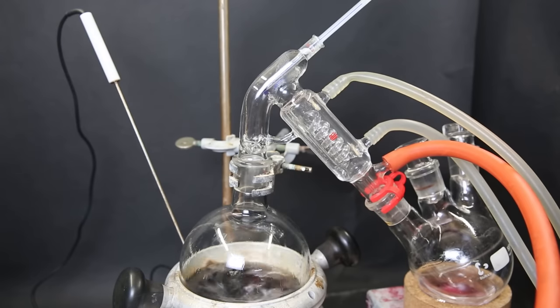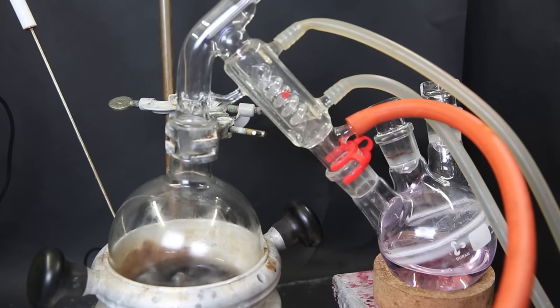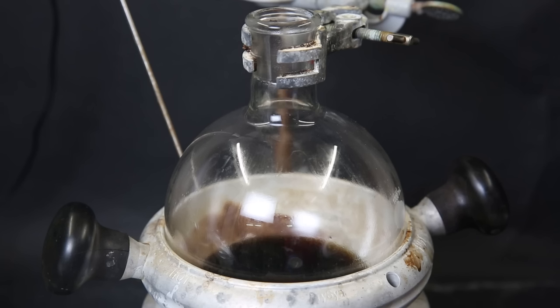And set the solution up for a short-path vacuum distillation to remove all of the THF. I wait until no more THF comes over. After that, I am left with a thick dark liquid and some pink THF as distillate. Now that all of the THF is gone, I can remove the lithium bromide that has formed during the reaction. Since lithium bromide is soluble in THF, I had to remove all of it. Now I can add a solvent in which the product is soluble, but lithium bromide is not. So to the flask, I add 500 mL of DCM and start stirring.